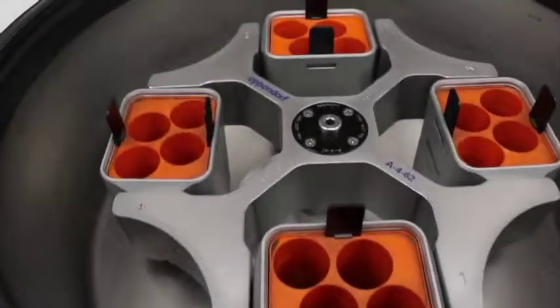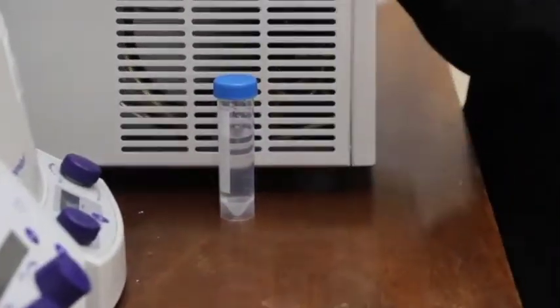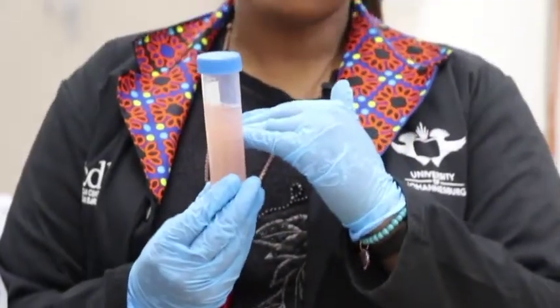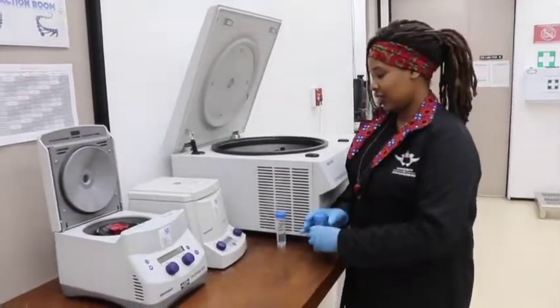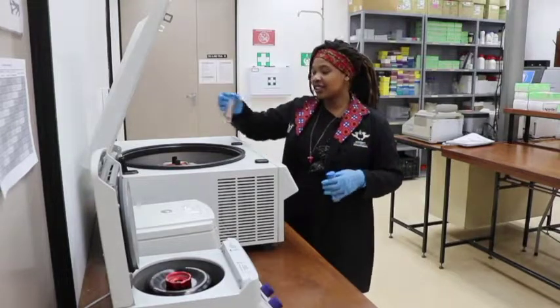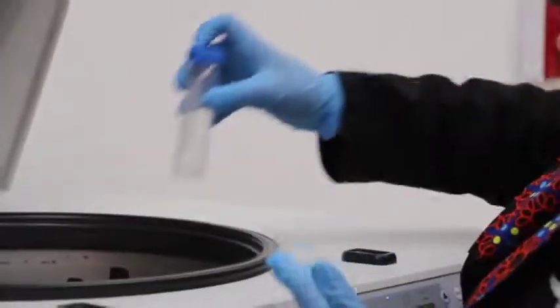After your sample has been shaken, the next step is to centrifuge — which is a form of shaking — but with this we actually separate our sample into layers where you find the DNA layer and the mucky residues. It helps us extract the DNA layer without the mucky residues. This is our centrifuge machine where we place our sample. One important thing with the centrifuge is that you must always balance it.